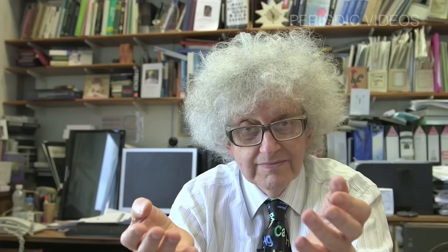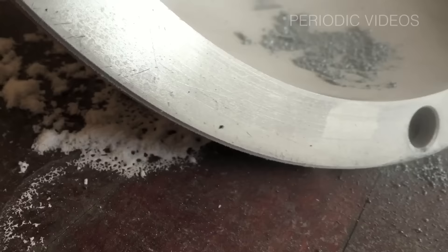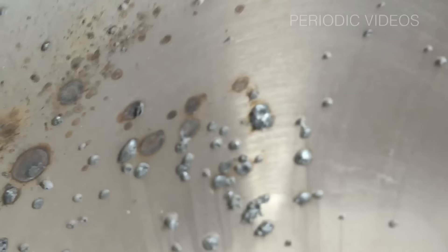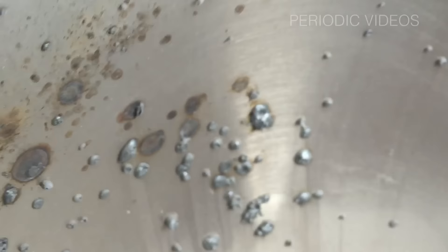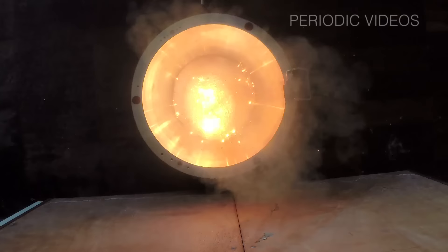Essentially, in all of it, the iron burnt. It didn't all burn, because at the end there were bits of iron left in the bottom. The chemistry is very simple.